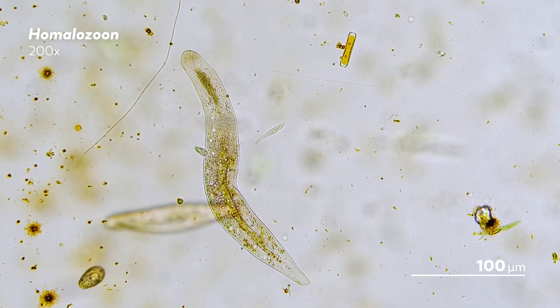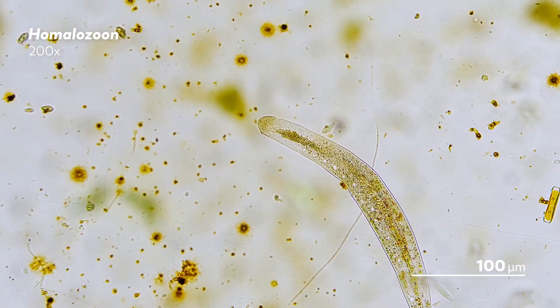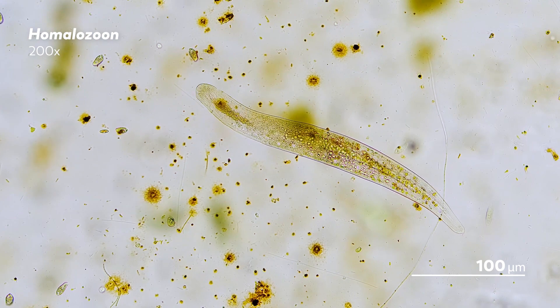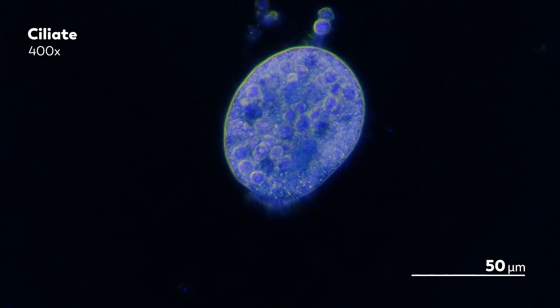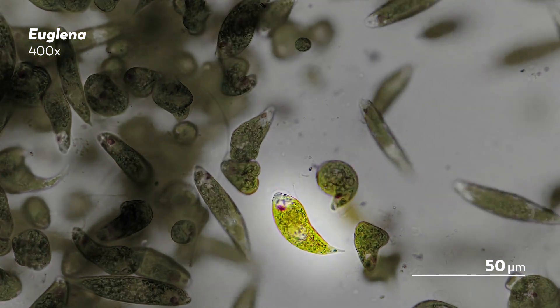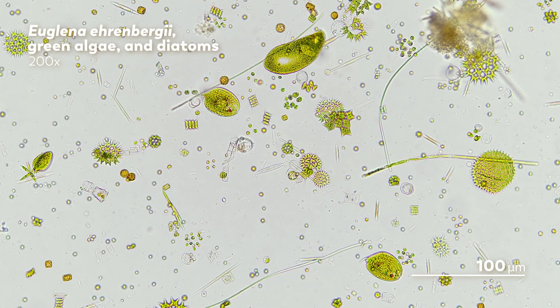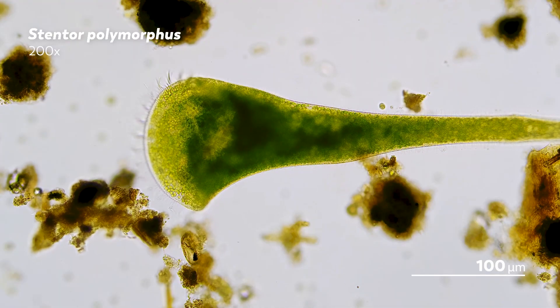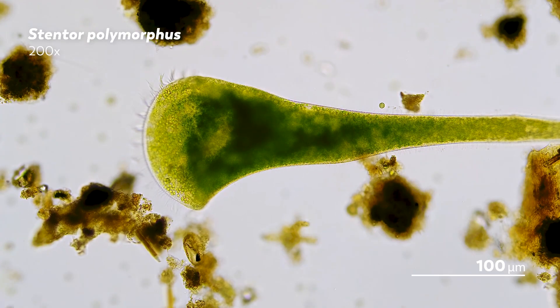With single-celled eukaryotes, the process starts to get more difficult. You won't see the complex structures and systems that distinguish multicellular organisms, but you will see organelles that can help clarify what you're looking at. One major clue is picking out which organisms have those beating hairs called cilia versus which ones have more whip-like hairs called flagella. And if you see the green color of chloroplasts, you know that you need to find an organism capable of photosynthesis. For example, what if you see the telltale trumpet morphology in your collection? Aha — you might say, that is a stentor. And you would be correct.